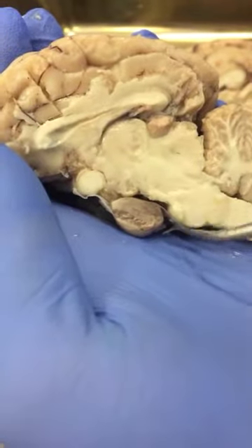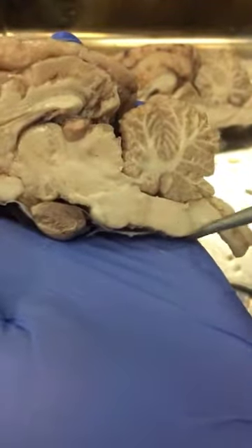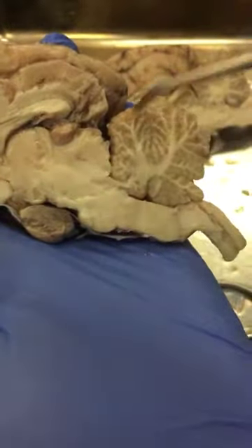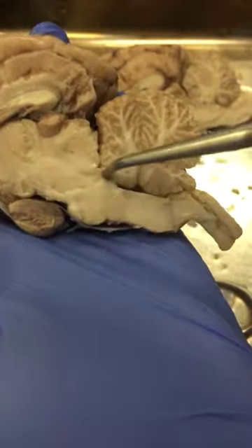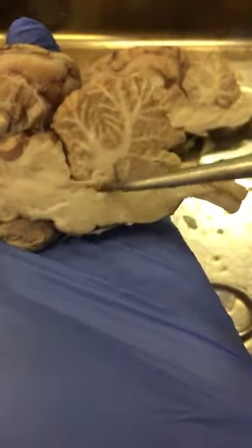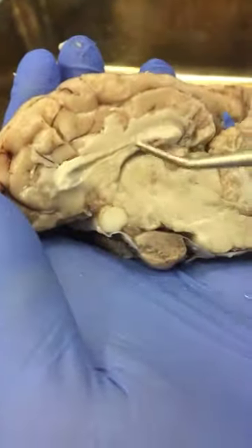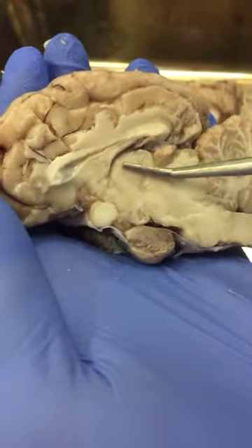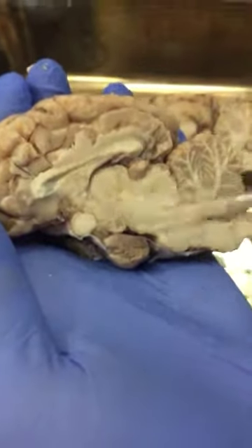The first big bulge is the pons, and then the medulla oblongata is inferior to that, kind of across from the cerebellum with the arbor vitae, and the fourth ventricle, which you might be able to see the cerebral aqueduct going up to the third ventricle. The third ventricle is the space between the two hemispheres of the thalamus and the hypothalamus, with a little circle in the middle, which kind of makes it look like a duck head.